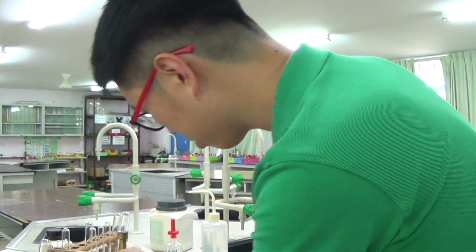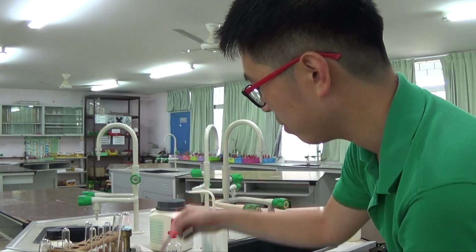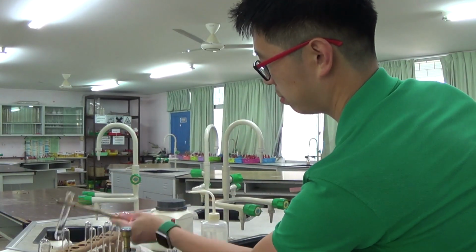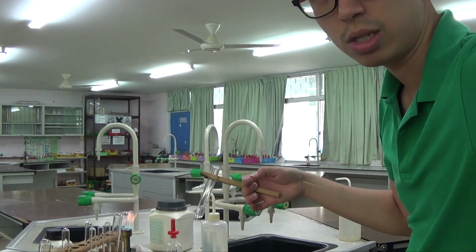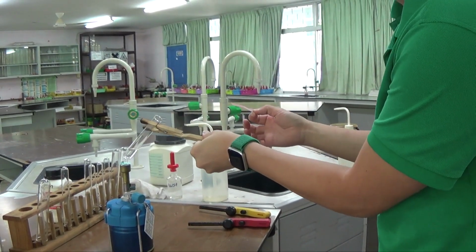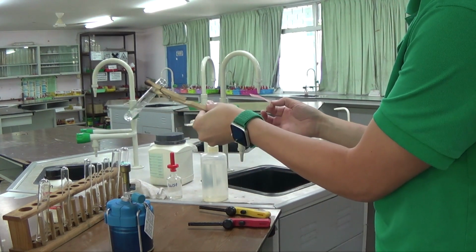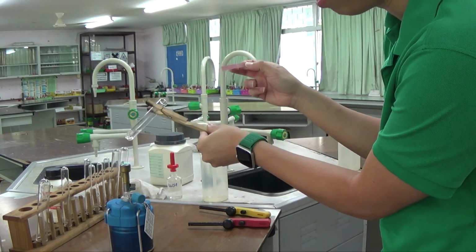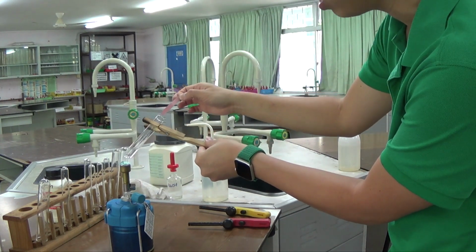So close the air hole. There's the yellow flame, there's the blue flame. This is my red litmus paper, so it's a bit moistened at the end. So heat it. When you heat it, make sure you are not pointing the test tube at yourself. There are a bit of bubbles now, so make sure you don't just heat it in one place. Hold it and swirl it a little bit. You can see the bubbles given off because there's a gas being given off. So what I do is I put my red litmus paper on top there. Do not touch the side.